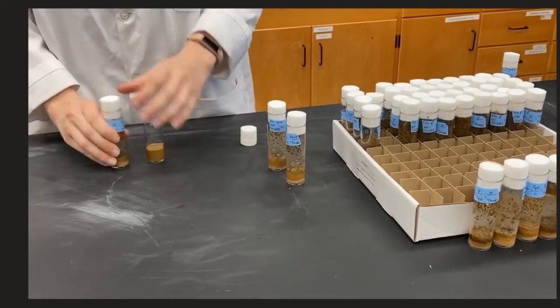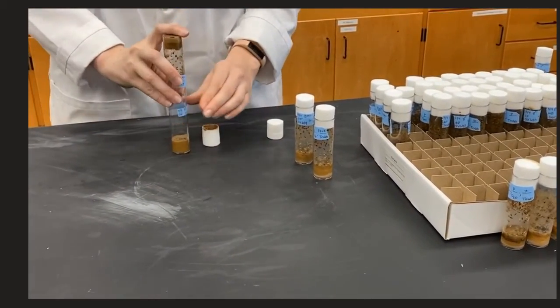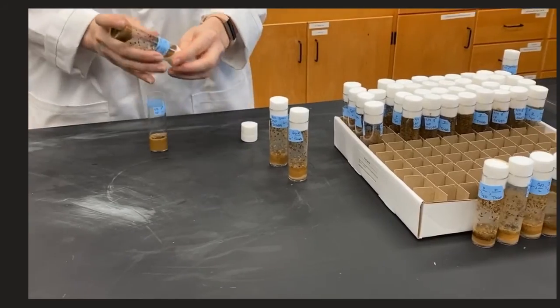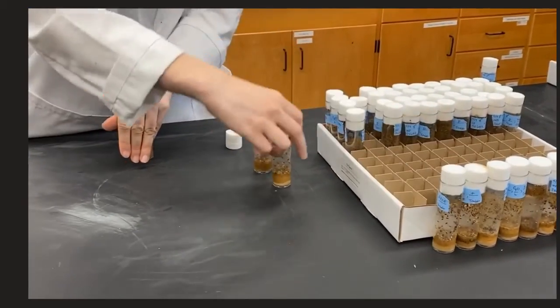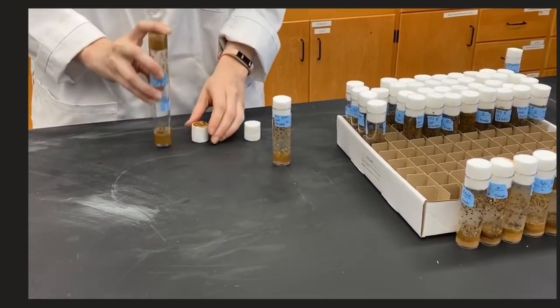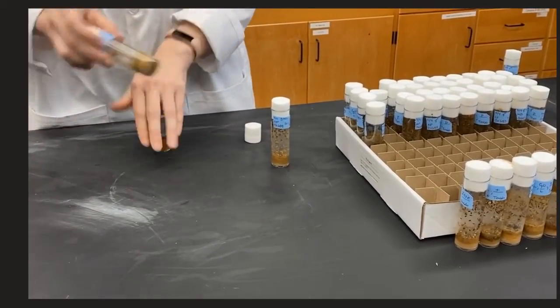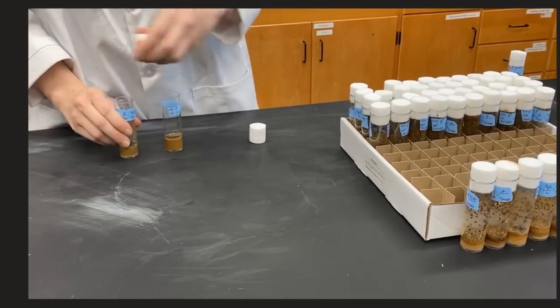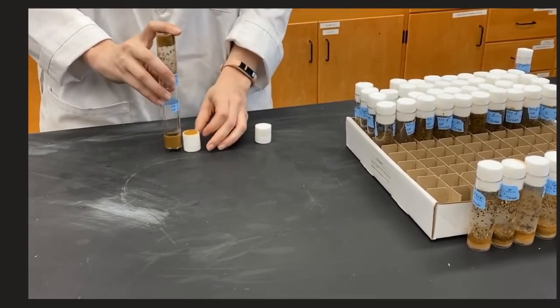She will open the new vial, tap, flip, tap again, and you can see she's covering the new vial with her hand to prevent any escapes. She does this with each of the three oldest vials.